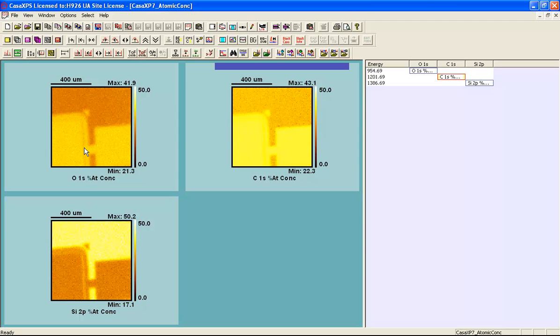And we can see from these atomic concentrations that the carbon correlates with the oxygen, and the oxygen can be viewed in terms of this silicon, in the sense that the silicon is showing there's less silicon where there's more oxygen and more silicon where there's less oxygen. So that would be consistent with a different film thickness of the oxide. So the variation that we're seeing here is due to different film thicknesses of silicon oxide on silicon.